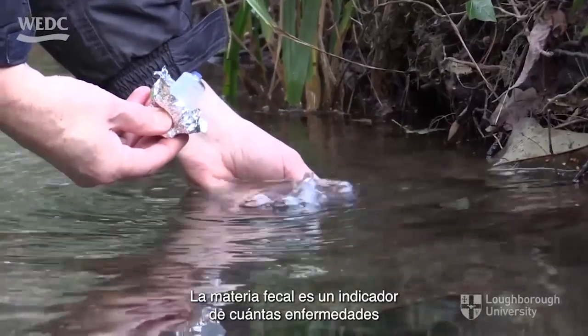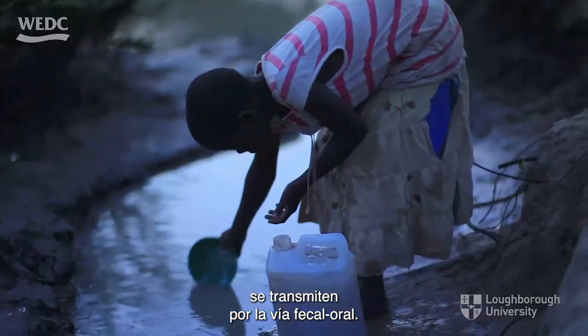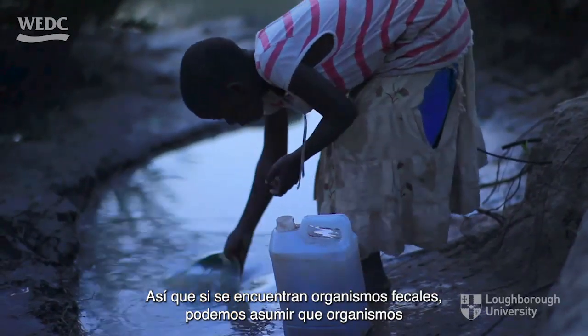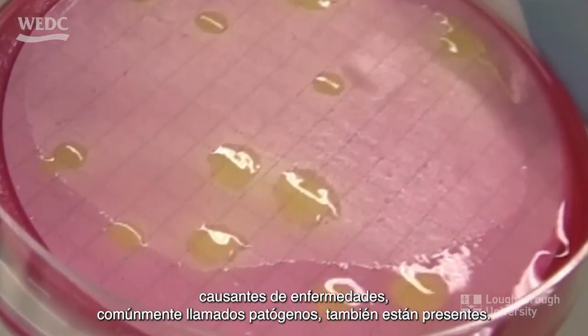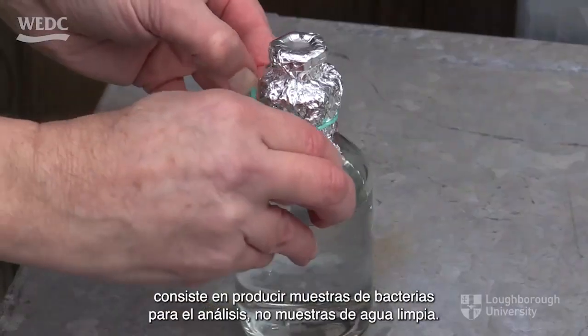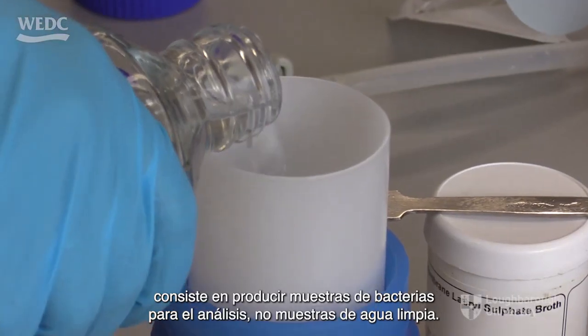Fecal matter is an indicator of many diseases that are transmitted by the fecal-oral route. So if fecal organisms are found, we can assume that disease-causing organisms, commonly called pathogens, are also present. So this microbiological process is about producing samples of bacteria for analysis, not samples of clean water.